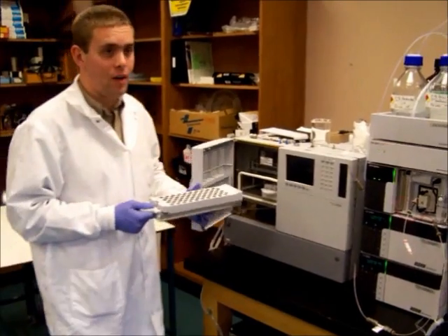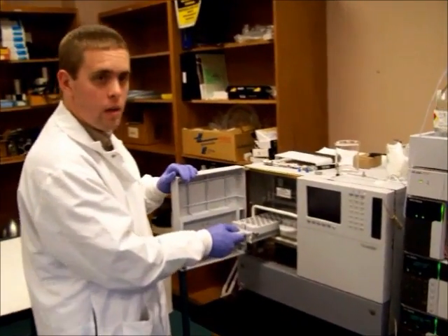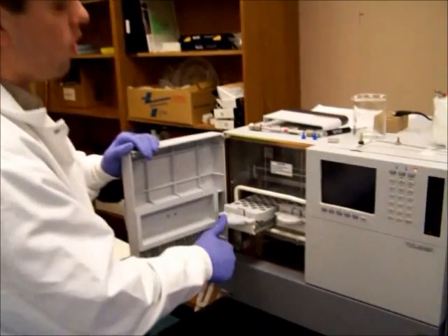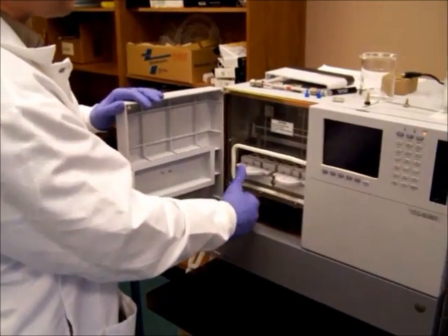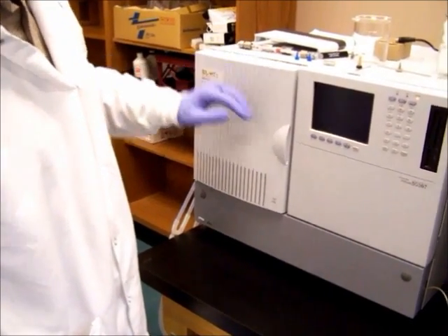We just load it into the machine. Come on, look closer. Load it in, make sure it clicks. That way you know the tray is in the machine. Close the tray.